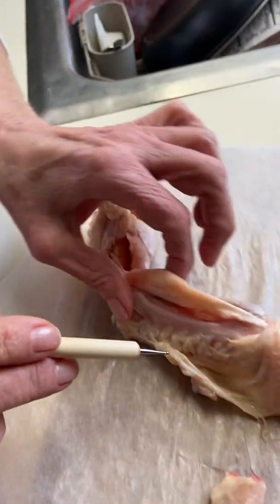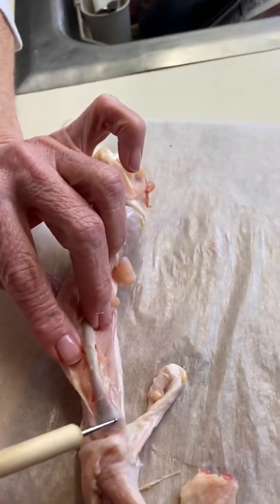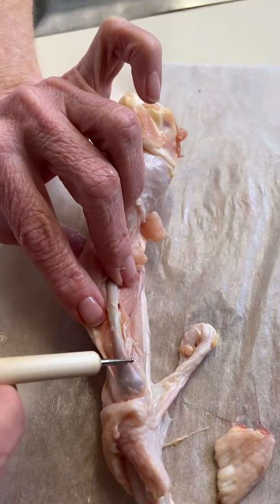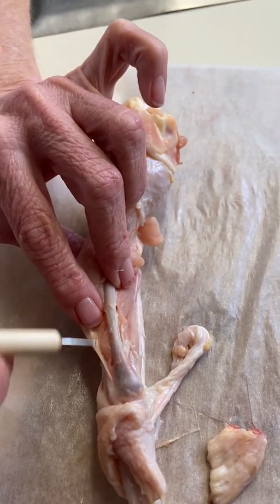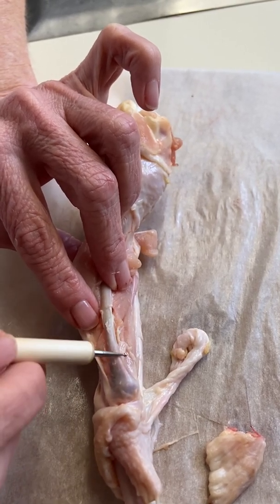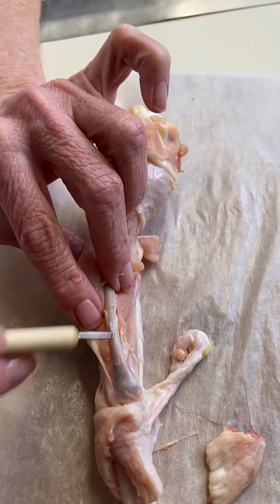Moving on to compact bone, I'm just going to get here. Compact bone, the head of the bone is where we have spongy material, but the compact bone would be like your outer lining of the bone here. So that would be very strong, actually. So that would be where that's located.